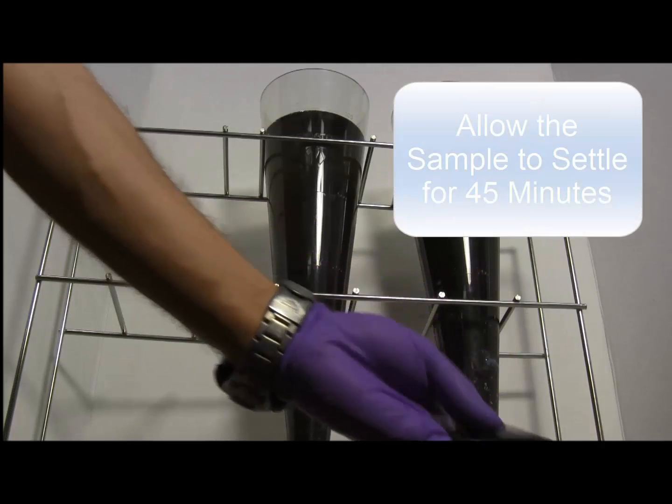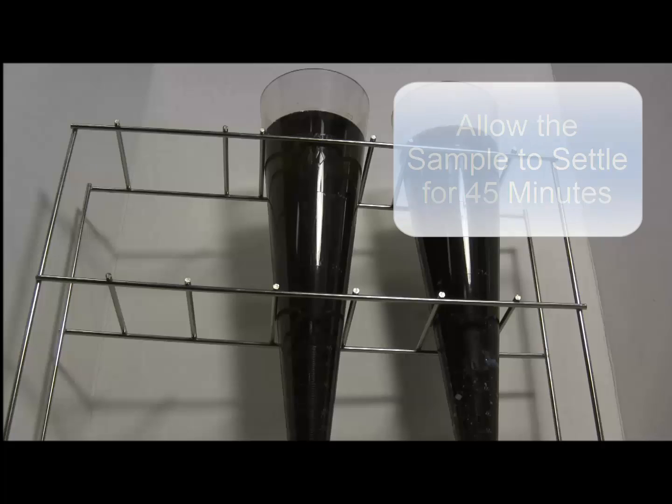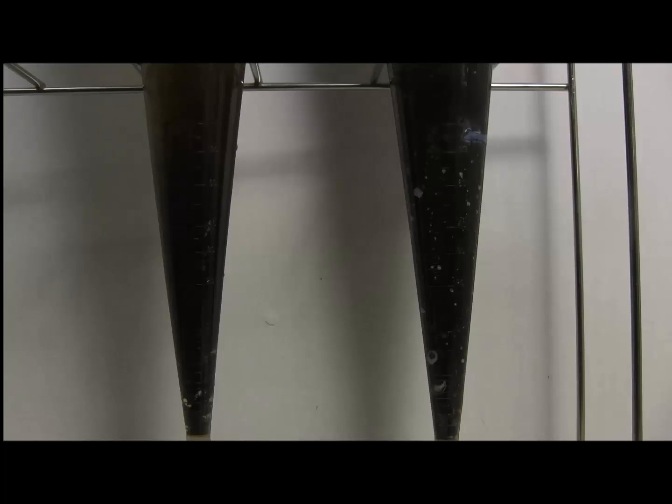At this point start your stopwatch or timer and allow 45 minutes to pass. This will allow the settlable solids to begin falling out towards the bottom of the Imhoff cone.